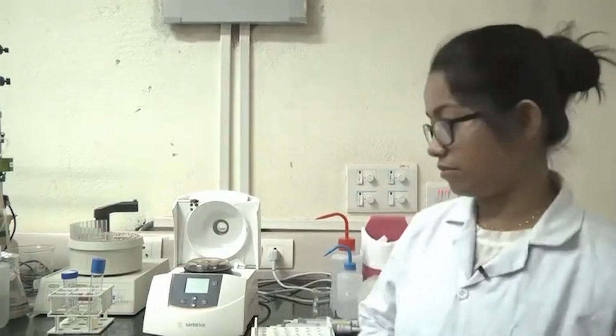Before we start getting into the plasmid extraction, there are a few things we need first. One is the bacterial culture. Usually we use an overnight culture. Overnight culture means around 12 to 15 hours of growth of the bacteria, and usually the bacterial strains are XL1, BL21 or DH5 alpha strains of E. coli. These have a high copy number of plasmid, and they maintain the plasmid in their cells.